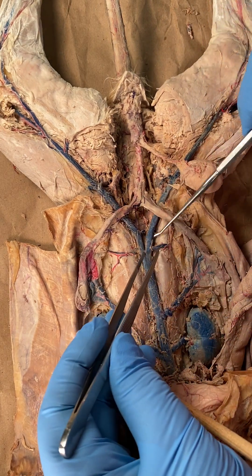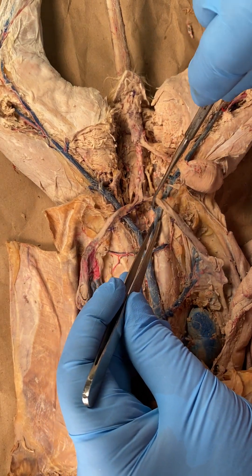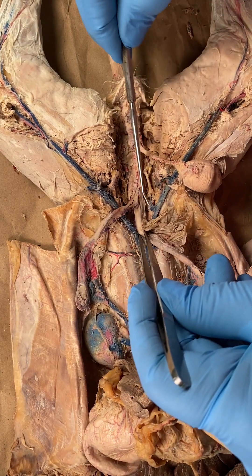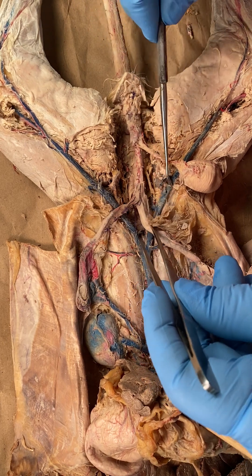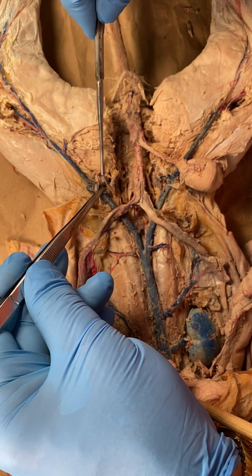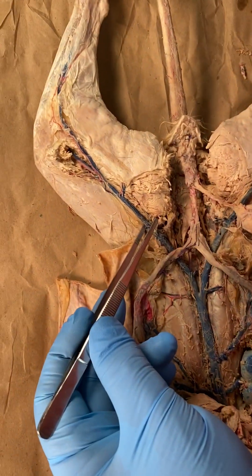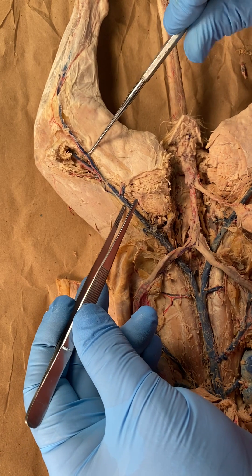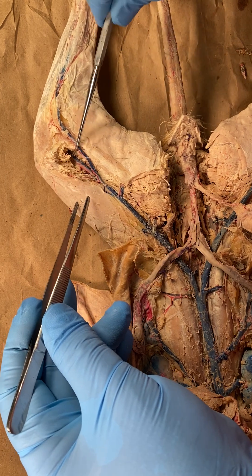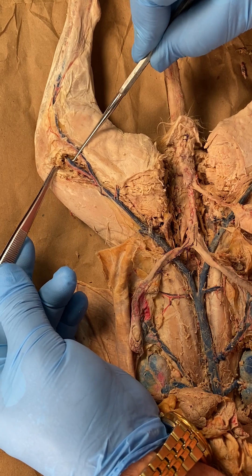Let's do the right side: right common iliac, and we need to find the internal iliac on the right side — notice how much further down it is, way down there. There's the right internal iliac, and so now there is your right external iliac. Here's your deep femoral on the right side, deep femoral on the left side — it's broken but you can see where it was. Now you've got the femoral, then superior saphenous, superior geniculate, and down to the deep popliteal. Everything after the external iliac is exactly the same as the arteries.